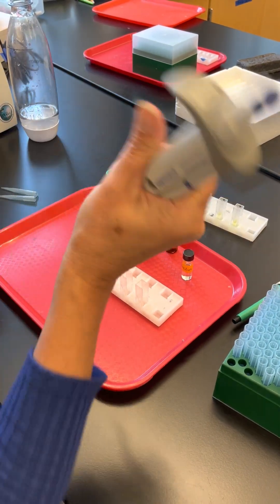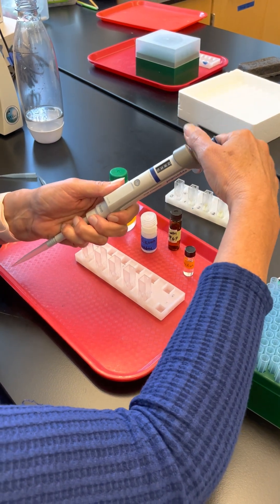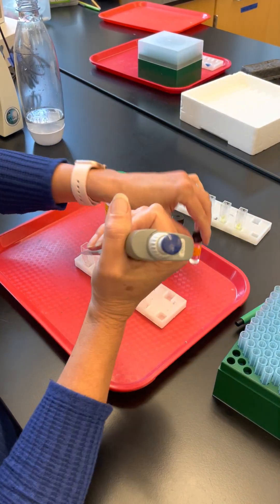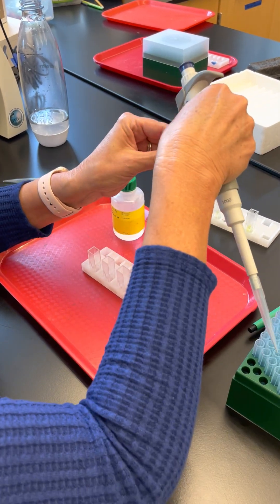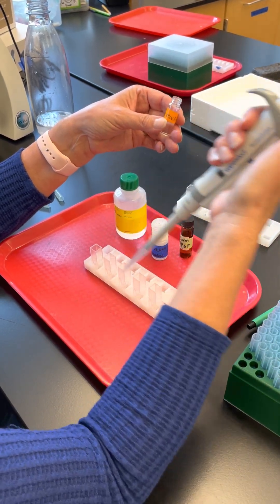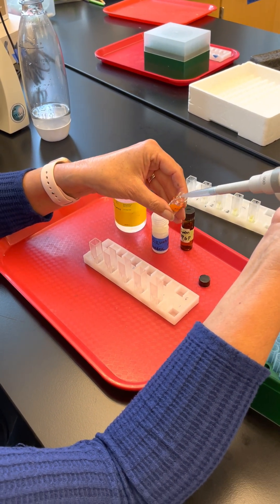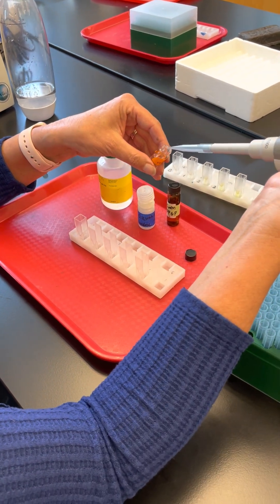Change tips and set the micropipette down to 500 microliters, because at one minute you're going to add 500 microliters of the reaction into the cuvette. These are called time points. If you're concerned it will take too long to measure, you can draw up the sample a few seconds early because the reaction will still be ongoing in the tip.